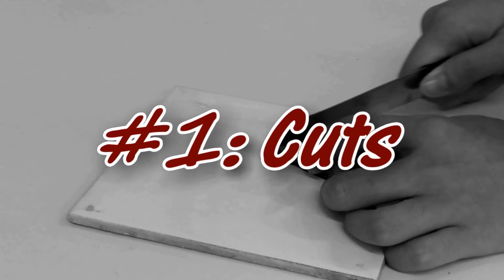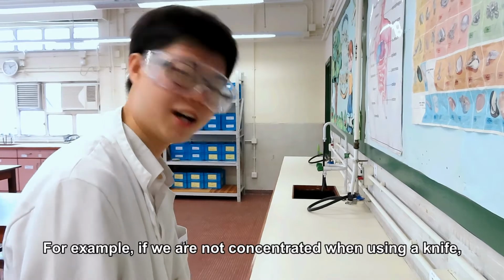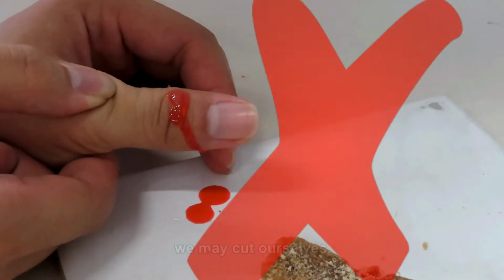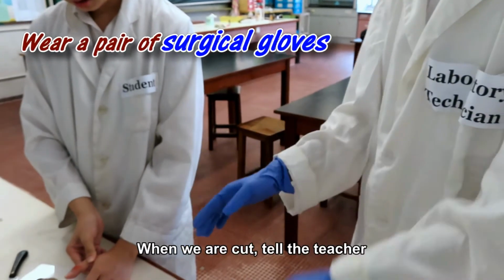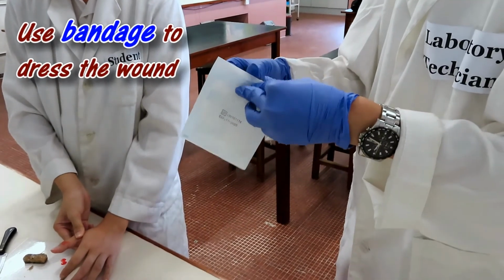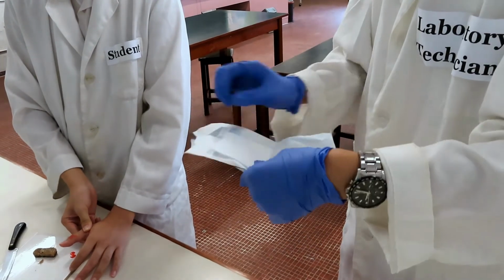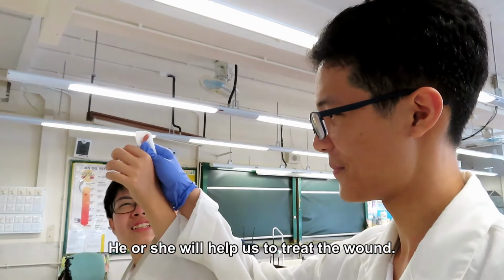Cuts. Several apparatus may cause cuts. For example, if we are not concentrated when using a knife, we may cut ourselves. When we are cut, tell the teacher and ask the laboratory technician for help. He or she will help us to treat the wound.